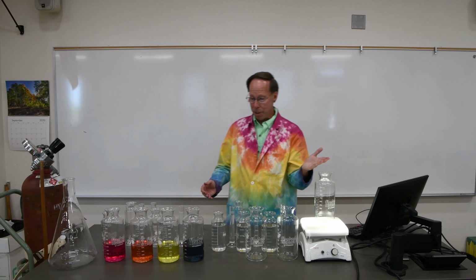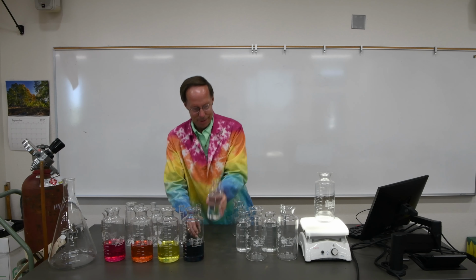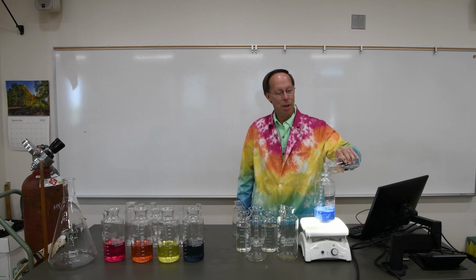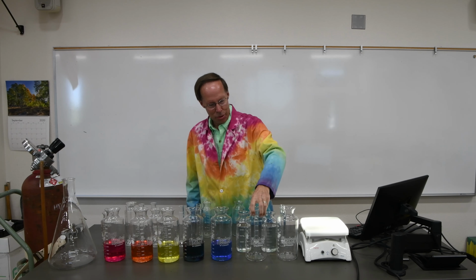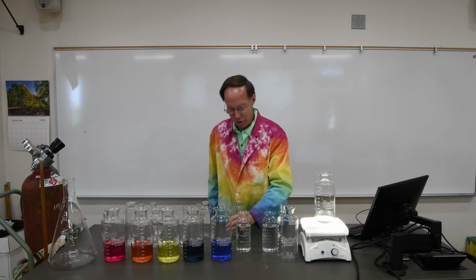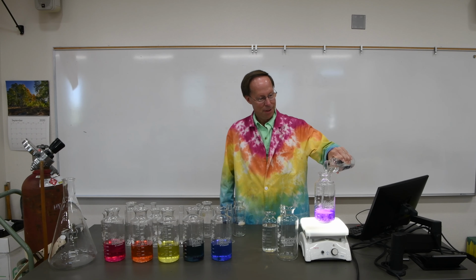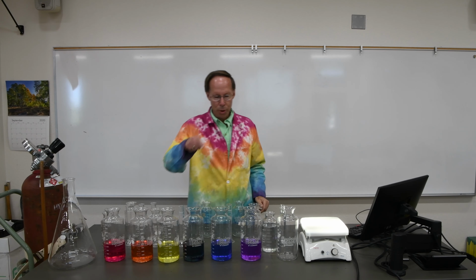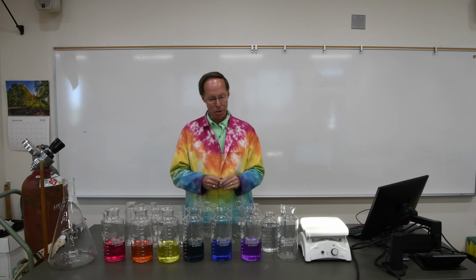If we go to our fifth one, we should be at blue. All right. And beautiful, a lovely blue color. And of course, last in the rainbow ought to be violet. So let's take our sixth beaker here. Add our first chemical, and let's see if we get the final color of the rainbow here. And there we go. So the colors of the rainbow: red, orange, yellow, green, blue, and violet. Sometimes they put indigo in there, but indigo is sort of difficult to see. It's essentially just a combination of blue and violet.